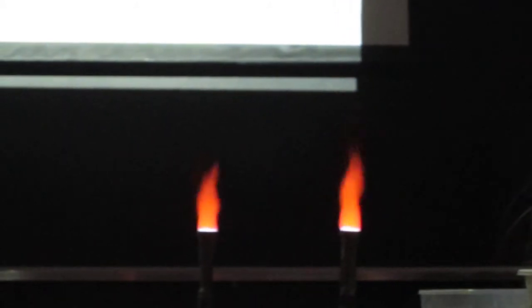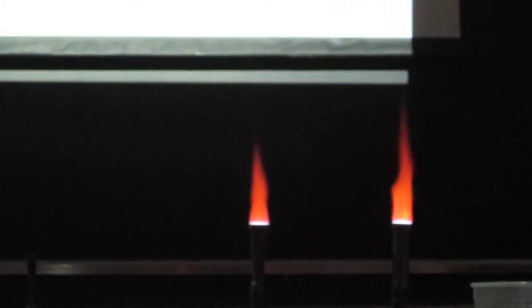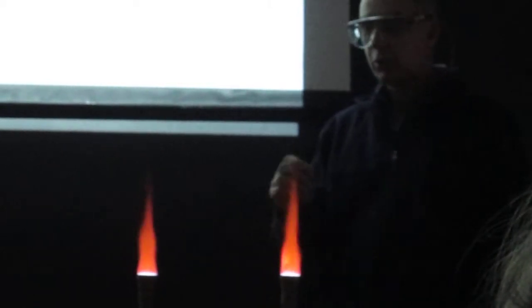Okay, so these are all different types of colors and they can be used to identify elements. So the old school used the flame test to identify some of these metals in solutions. I believe that we have more advanced techniques, but still this is a useful method to just find out what elements they are. Do you explain what happens?